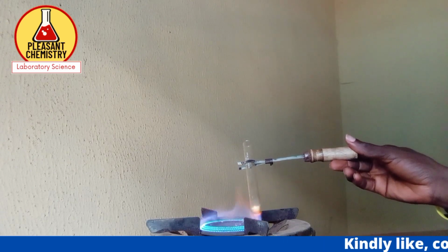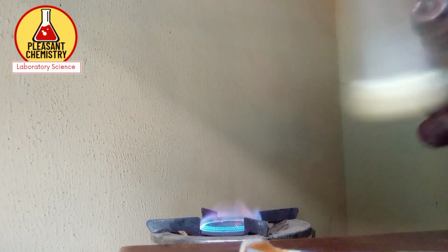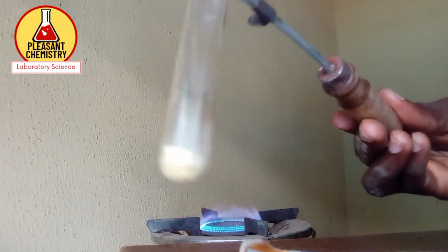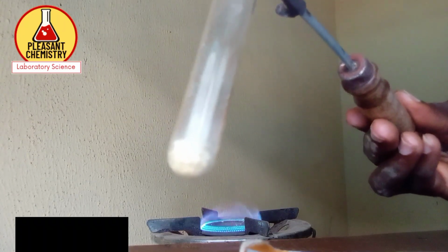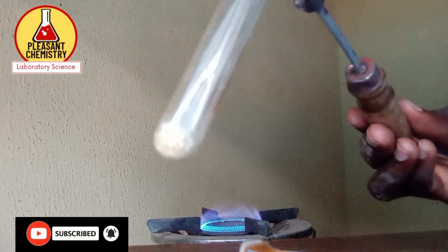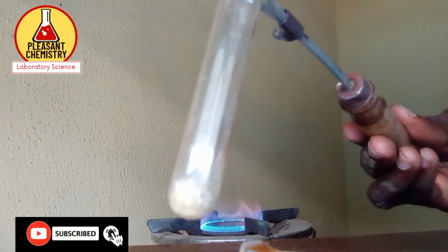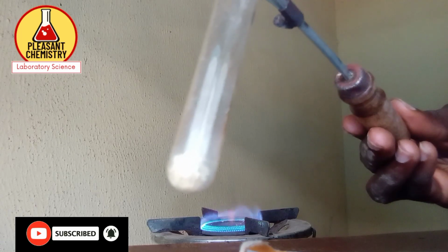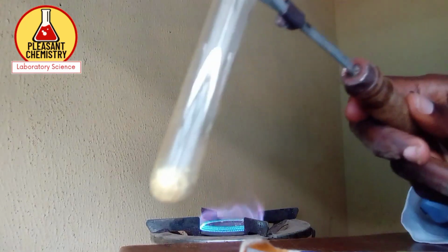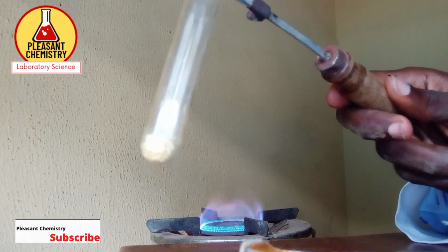So I've completely heated my sample D now. Let's see the color. Can you see the color? The color is yellow, even though you might not be able to see it clearly from the screen there. The color of my sample D is now yellow. It was white initially, but now it has turned yellow. Since my D has completely changed to yellow, it means that a reaction has already taken place.